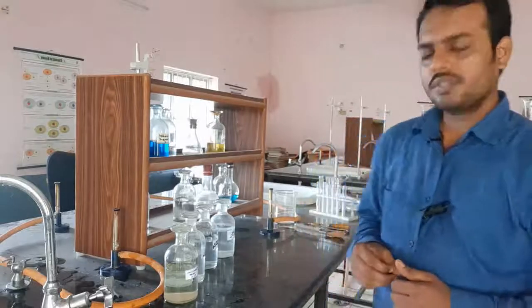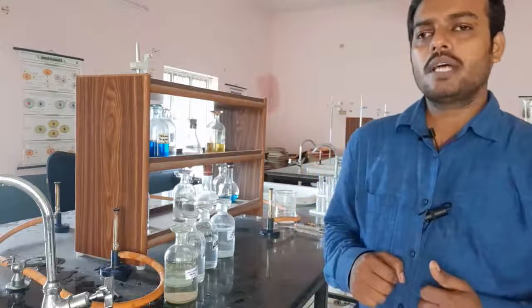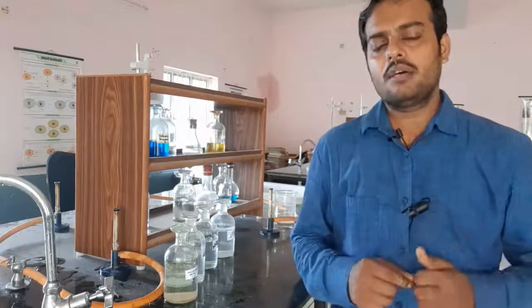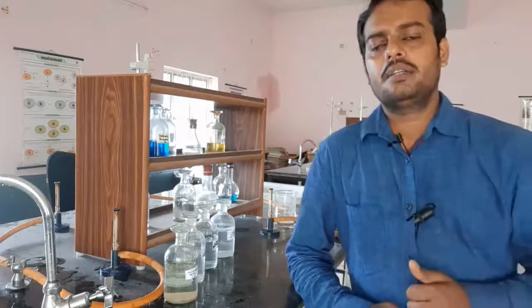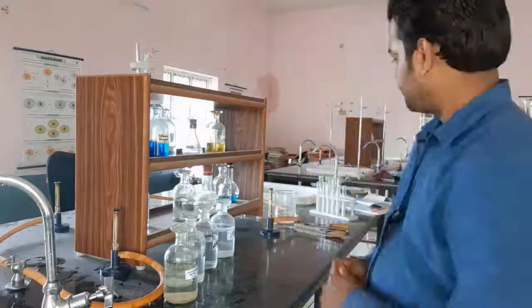So, first we are going to react barium chloride with sodium sulphate. You know that if the sulphate group is present in a given compound, then we can detect it using barium chloride solution. So, let us see the reaction.